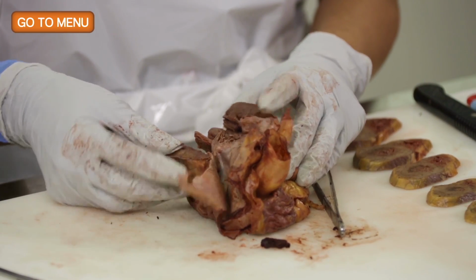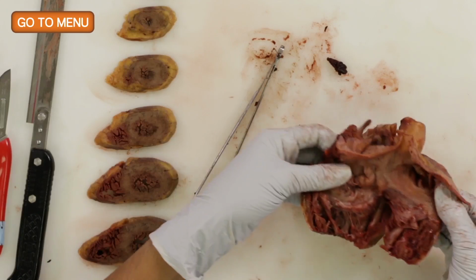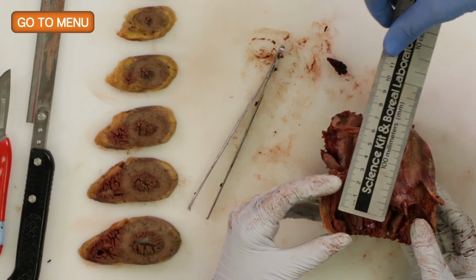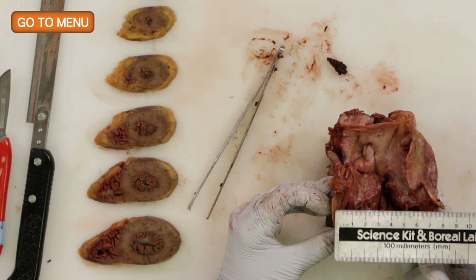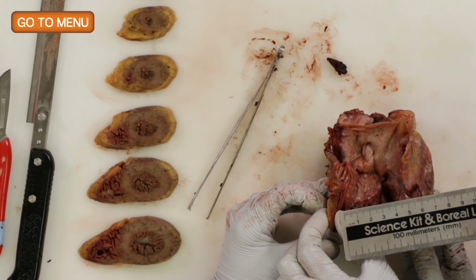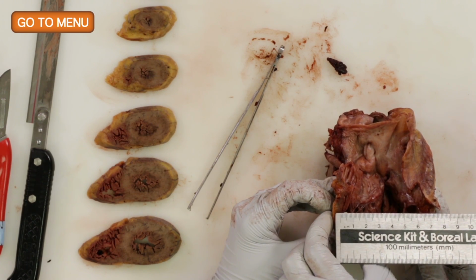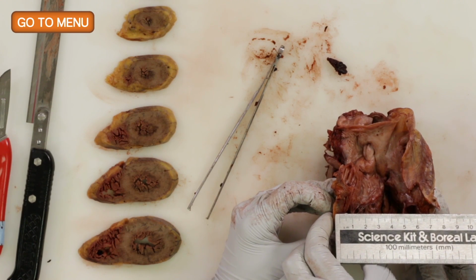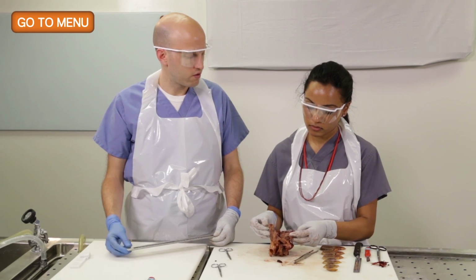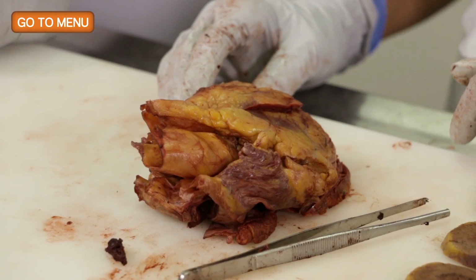And the same thing with the right ventricle. Okay, and it's much thinner, right? So you want to look at 1 centimeter below, and again, this is where you can measure a lot of fat and you get errors. So you can see the difference between the fat and the actual myocardium. So if you measure here and don't measure the papillary muscle, it's about 0.3 centimeters. Again, what's the normal right ventricular thickness? Less than 0.5. Yeah, so generally between 0.2 and 0.4. So we're right on track.